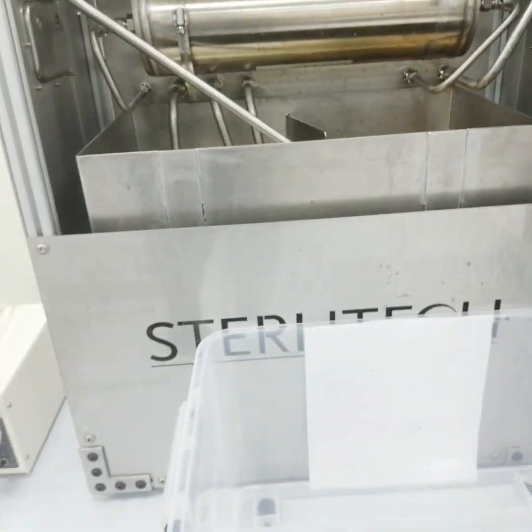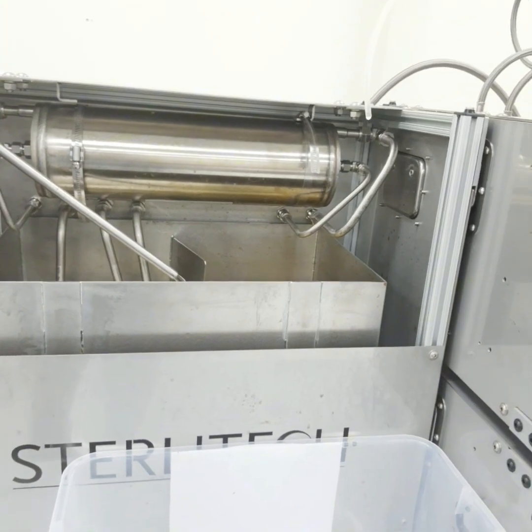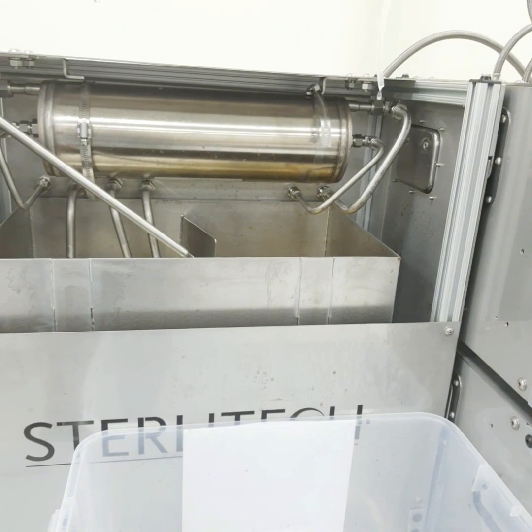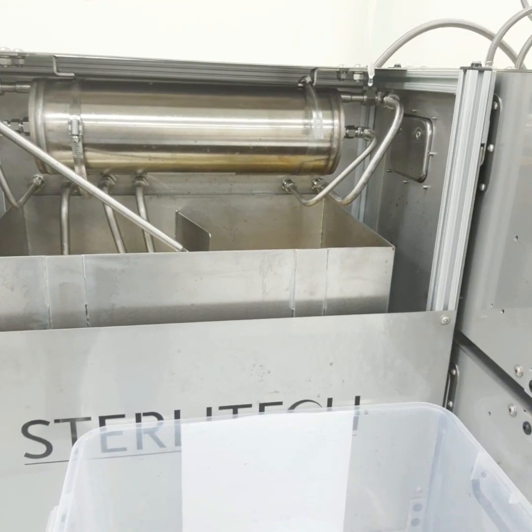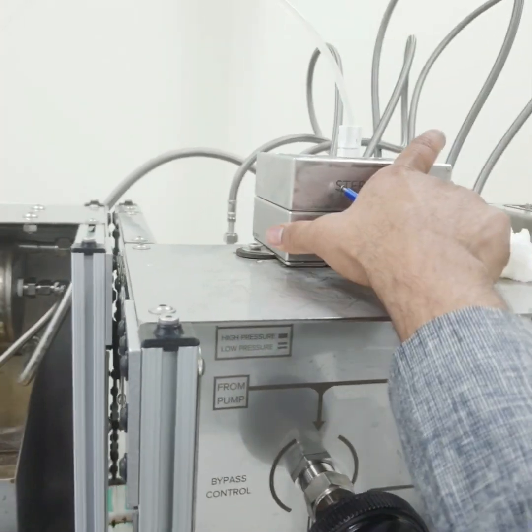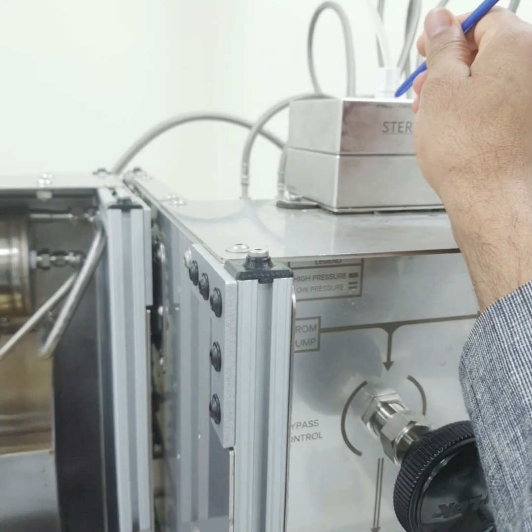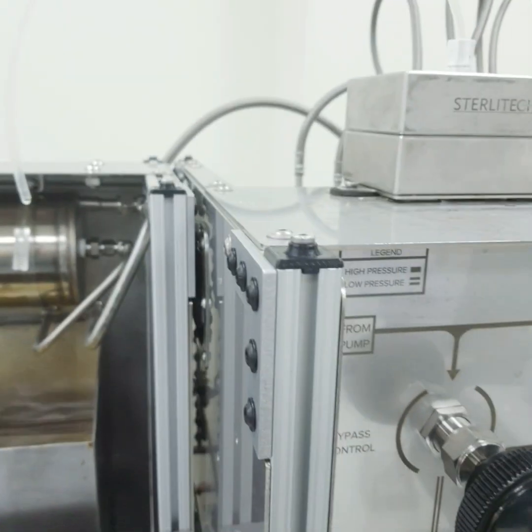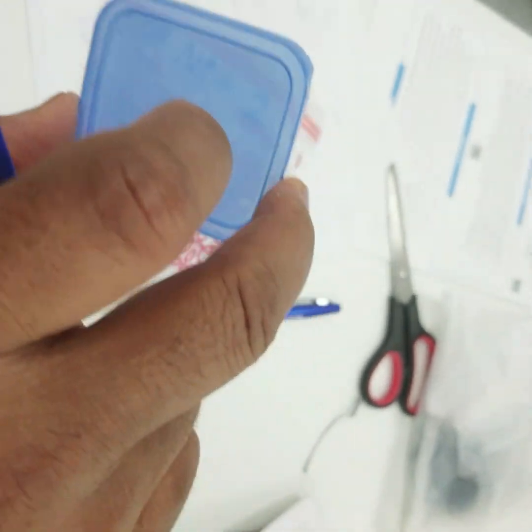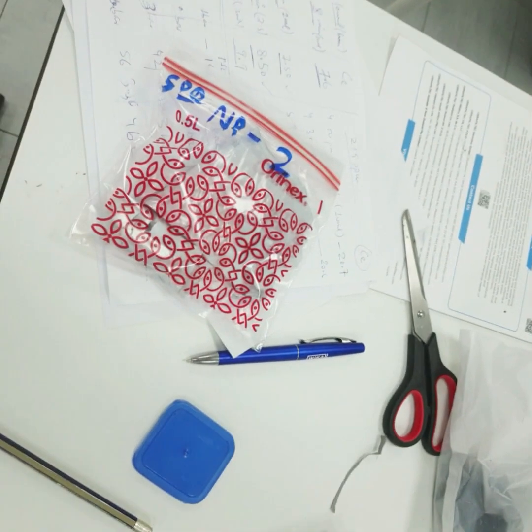After setting the pressure, we will again calculate the flux and also find out the separation for the tetracycline using the membrane added in this module, or you can say in this assembly. So we have added the membrane, which is a biochar based membrane. This is my biochar based membrane. We have cut the membrane according to this shape, and then added it to the module.